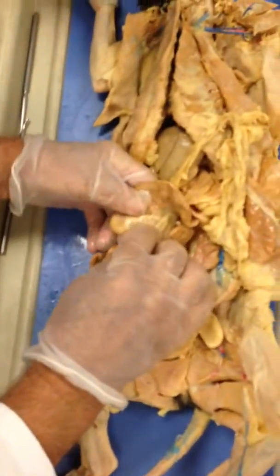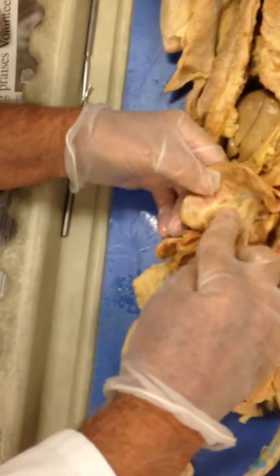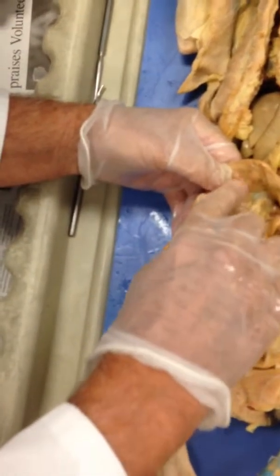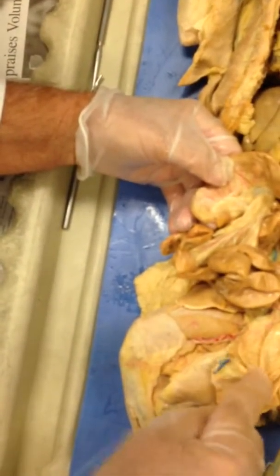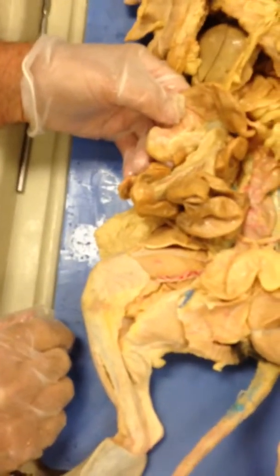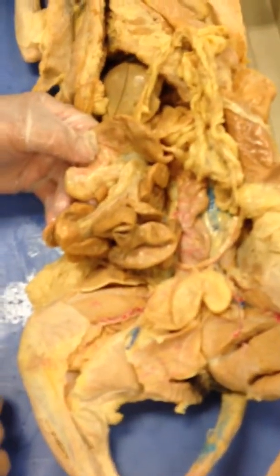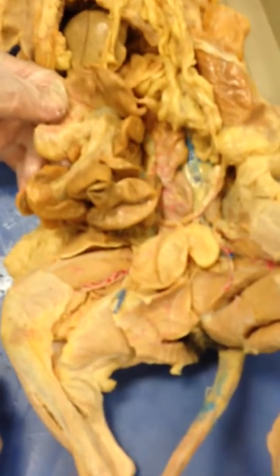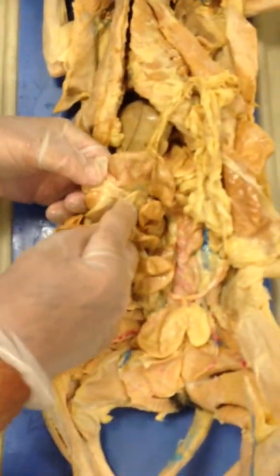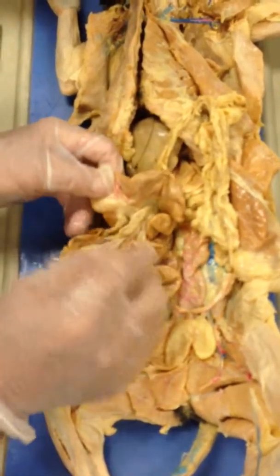And so right here, the small intestine, that's a loop of it, is joining the large intestine. Then the large intestine just goes up, makes a loop, and comes straight down. It doesn't have the parts on it that go around and around, like that one over there does, like the human does. And where those join, you have this blind pouch. See, here's the small intestine right here, and it's joining the large.